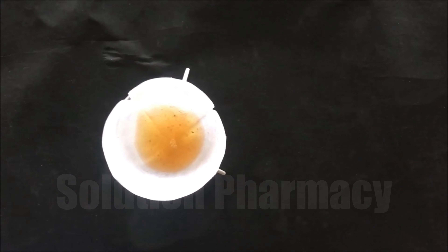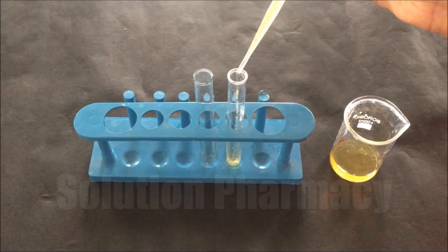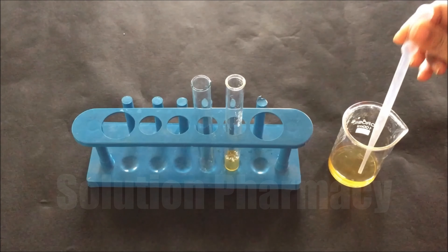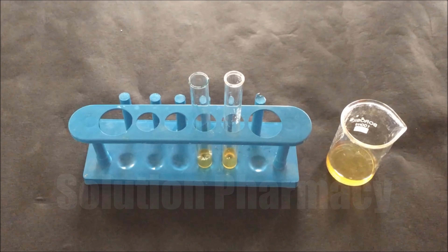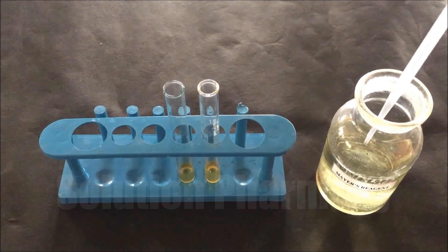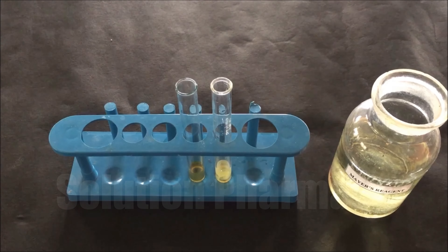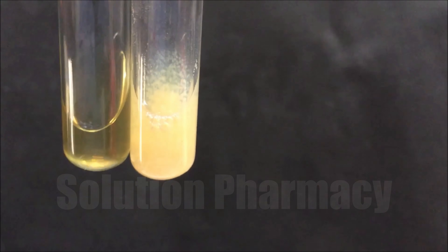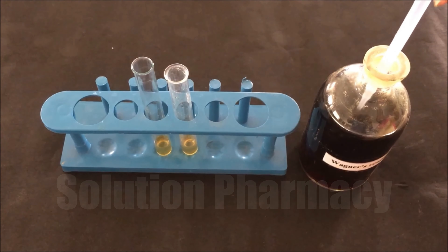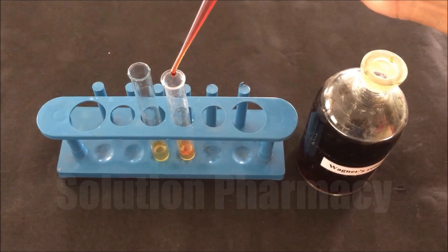After filtration, take about 2 ml of the liquid extract into a test tube and transfer an equal amount into a second test tube. We are going to perform Mayer's test: add a few drops of Mayer's reagent to one test tube and compare the changes with the second test tube. Formation of a cream precipitate indicates the presence of alkaloid in the sample — here you can clearly see the formation of cream precipitate. Next is Wagner's test: add a few drops of Wagner's reagent to the test tube.